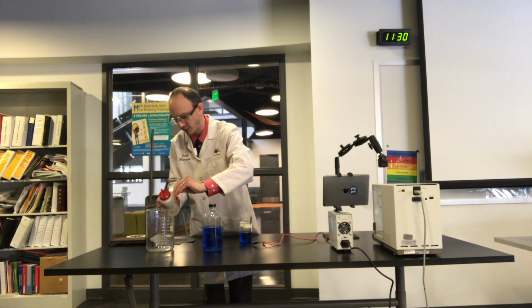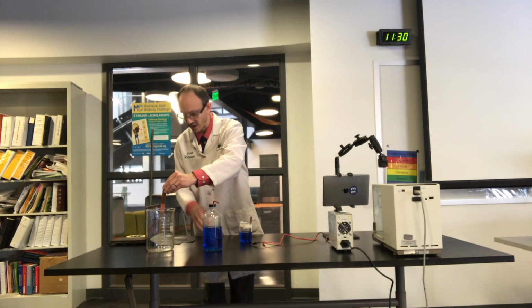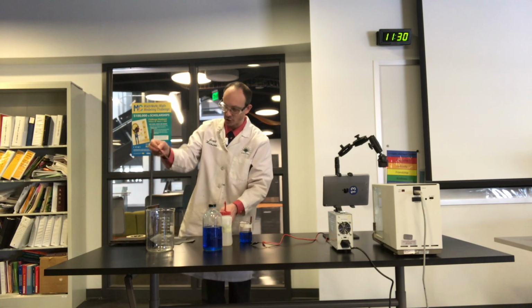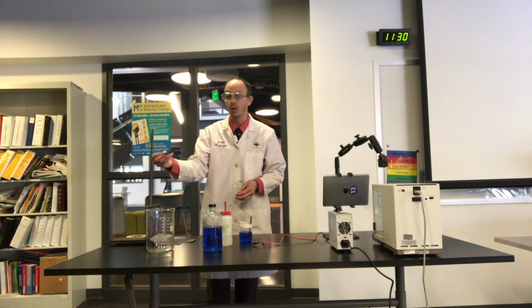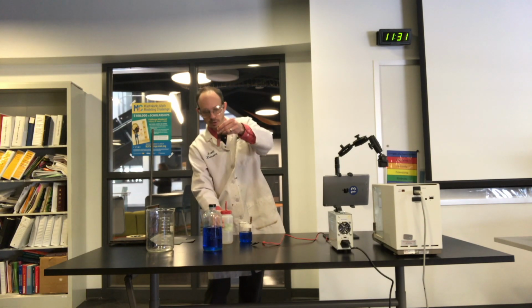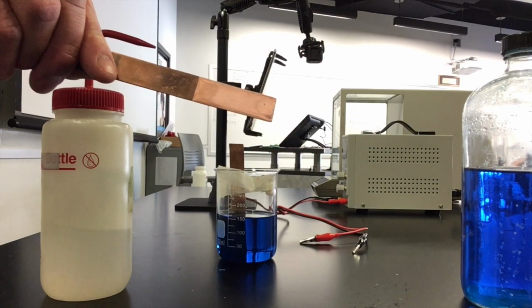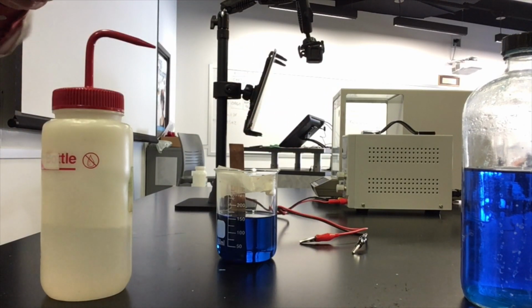I believe in your playing with video to be able to find that average amperage. Because if you find the average amperage, you only have to do the calculation once with that average amperage. Okay? So I'm just trying to get this electrode nice and dry, and it is.